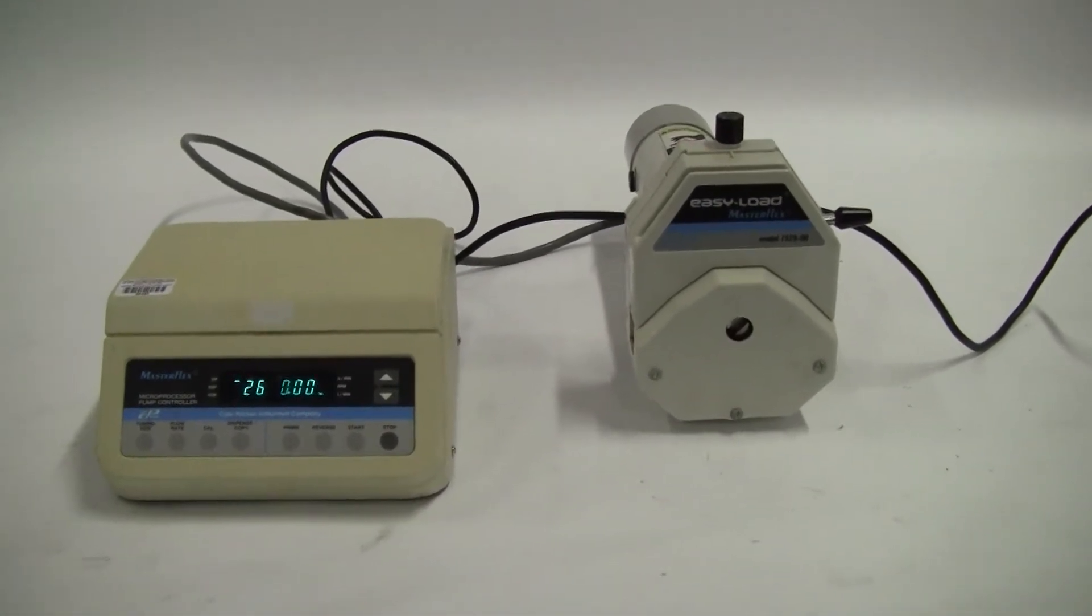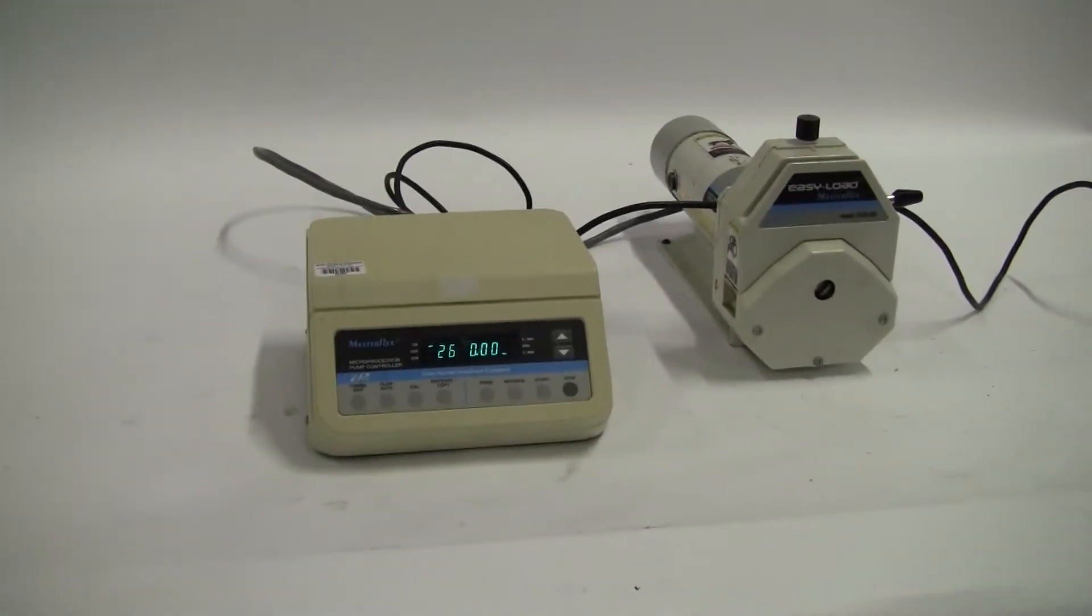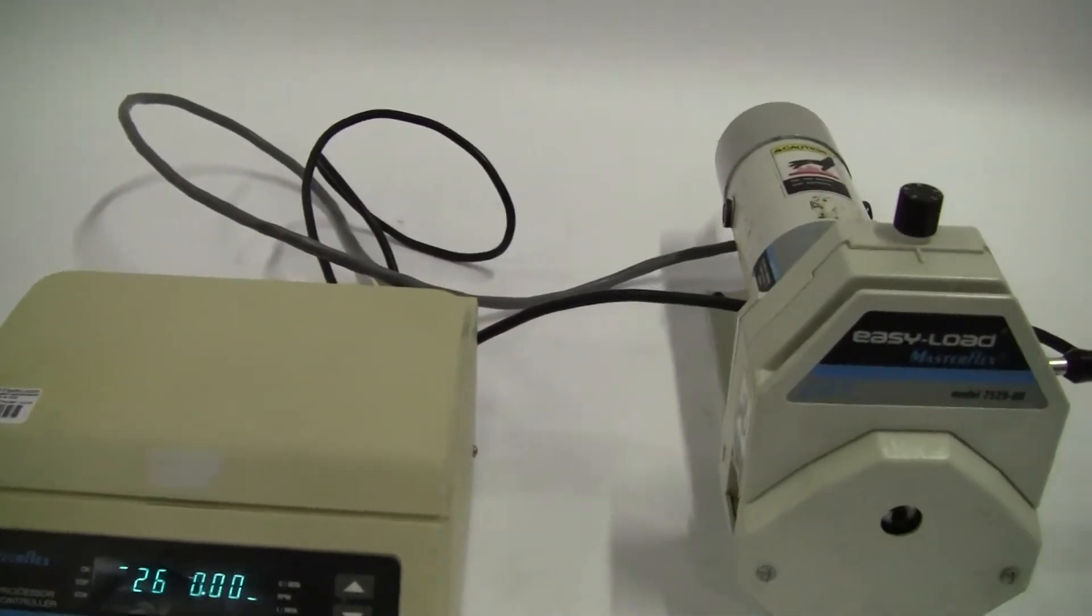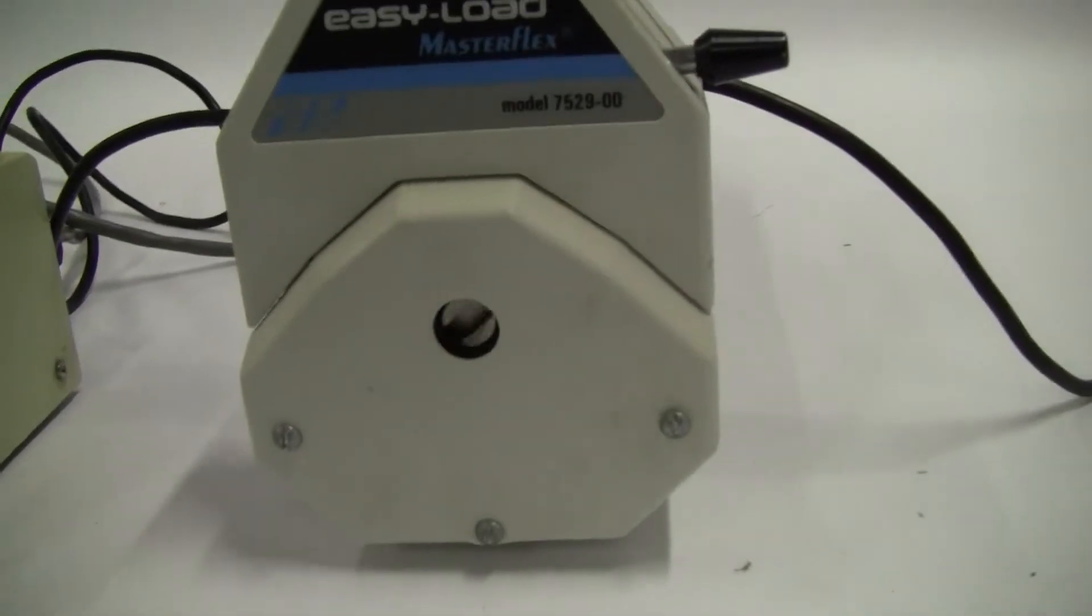You'll get different flow rates depending on your tubing size. Let's turn it on and see how it works. You can hear it. If you look closely, you can see the pump turning.